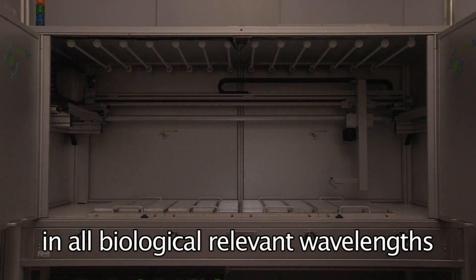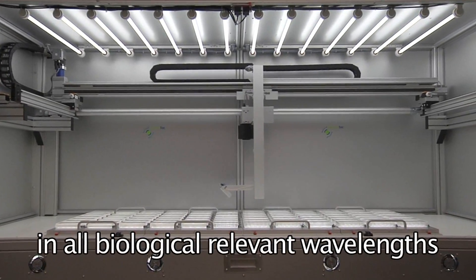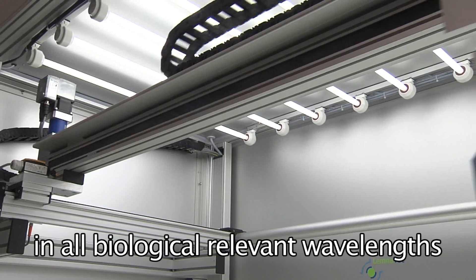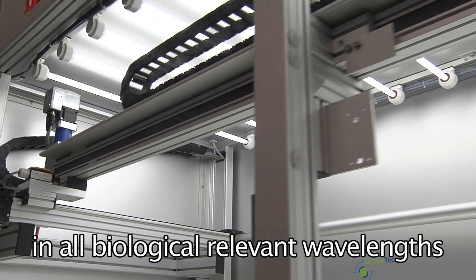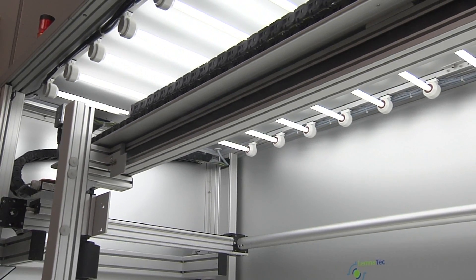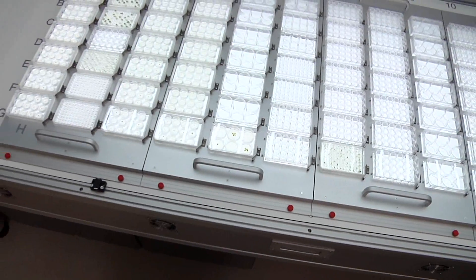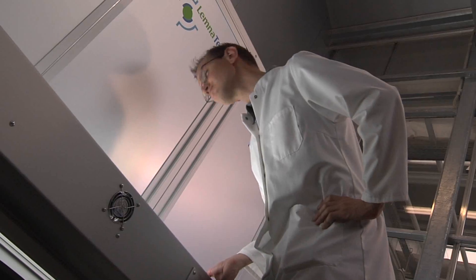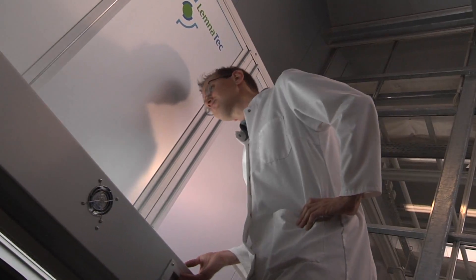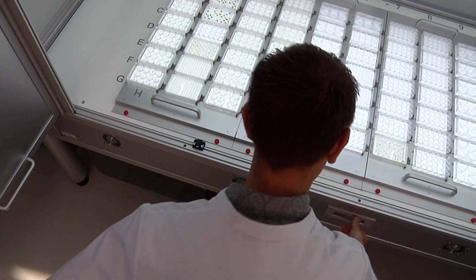The illumination system of the Lemnatec Scanalyzer HTS is fully controlled by the Lemnatec software and can be automatically adapted to different applications and objects. The user may choose between backlight, direct or diffuse top light, near infrared light, or blue light for fluorescent imaging.